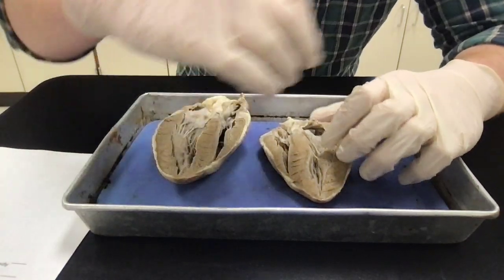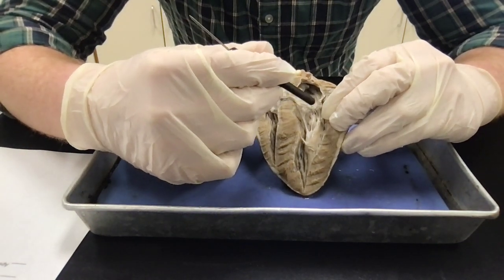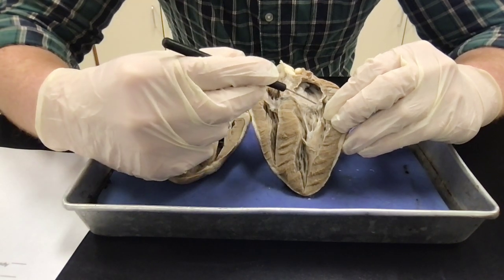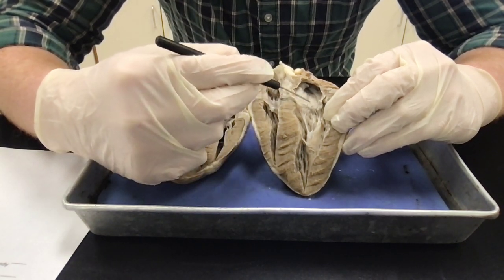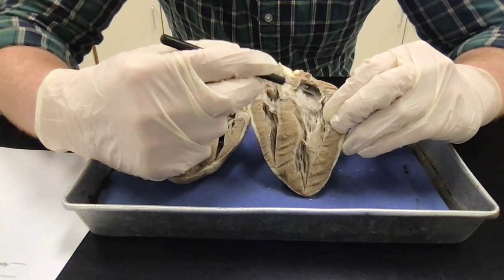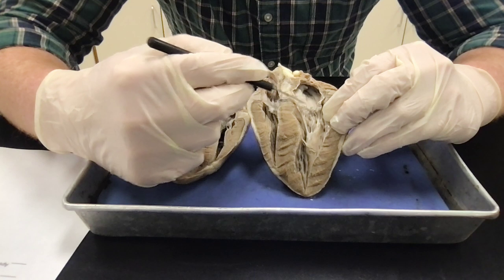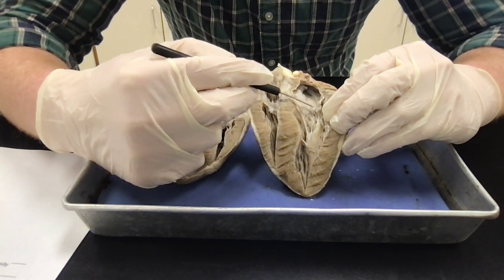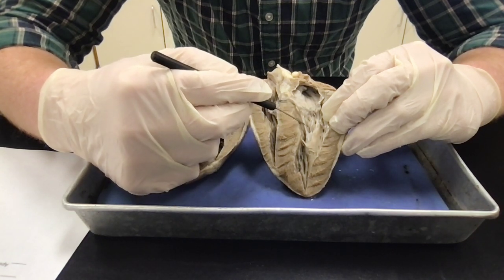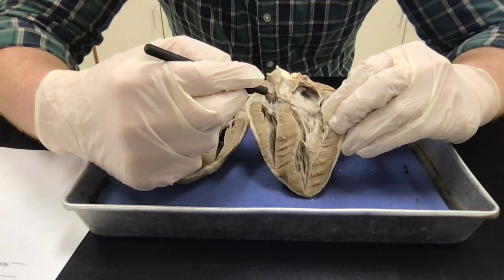Okay. Let's first talk about the four major chambers. This right here, as we said, is the left side of the heart, and then right here is a separating point, okay? Down here is your left ventricle, and then up here is your left atrium, excuse me, okay? And that's going to be separated by the bicuspid or mitral valve, okay? You can kind of tell because the chordae tendineae, which are these things up here, go to about the bottom of the atrium, okay?